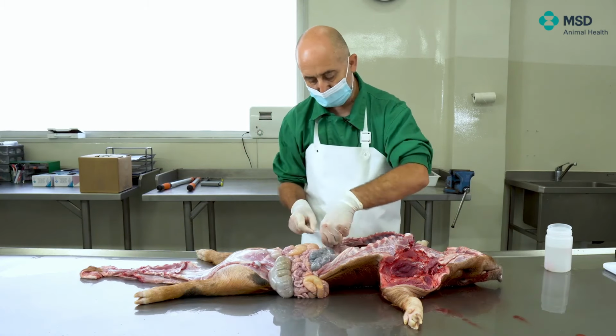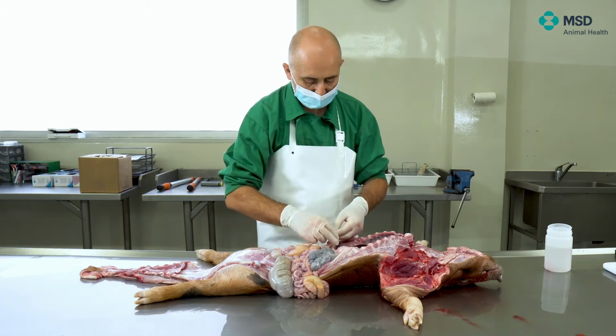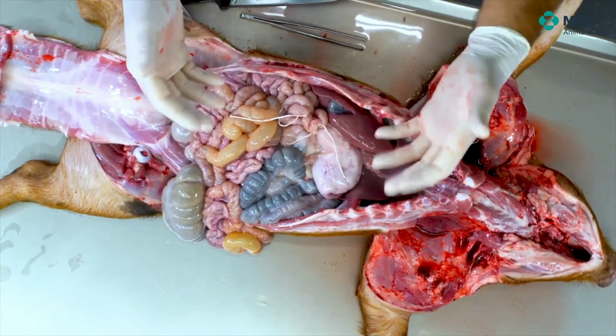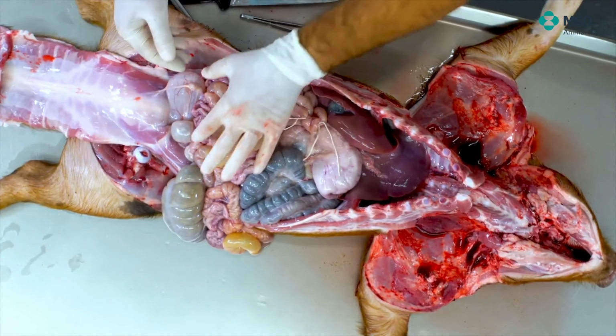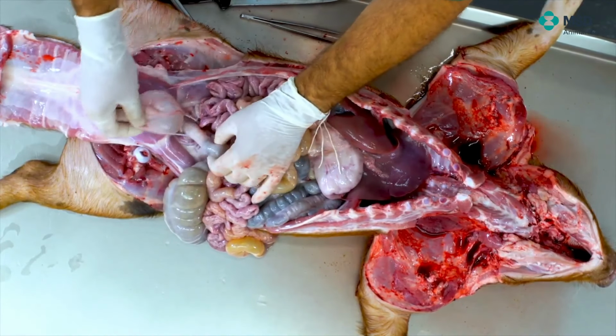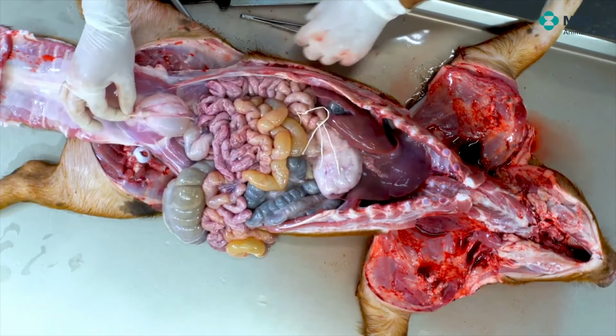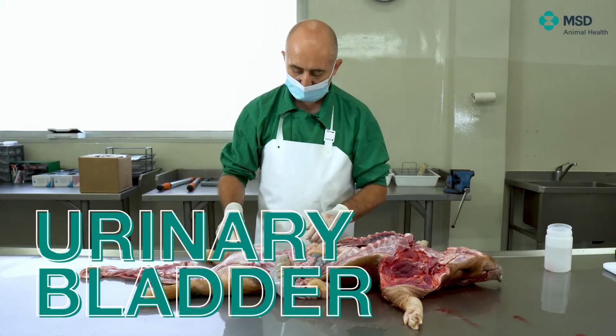I insist, this is something that we prefer to do, especially if we are doing a complete necropsy and we do not want to contaminate anything. The second knot is in the rectum, so if it must be in the rectum, we should go to the most caudal part. Here we have the urinary bladder, and here we have the rectum.